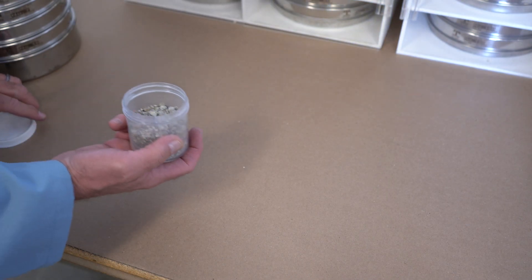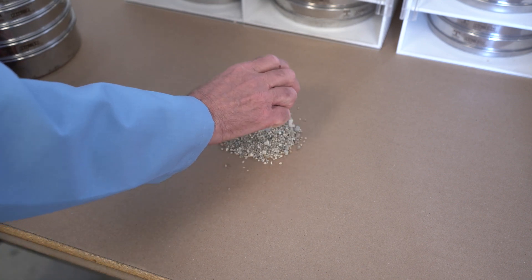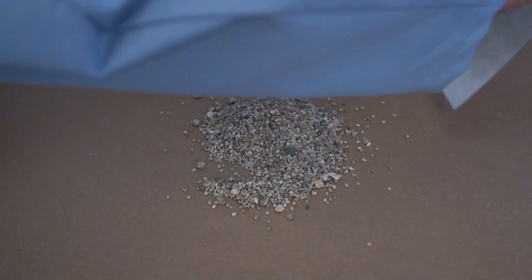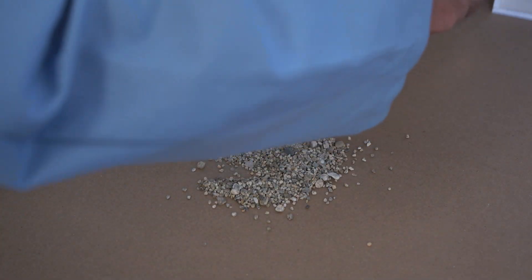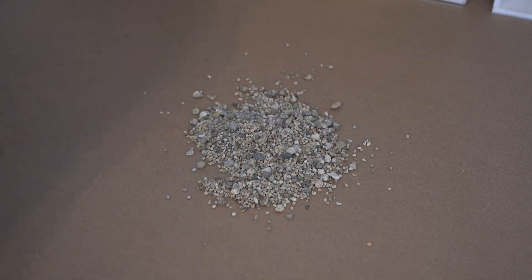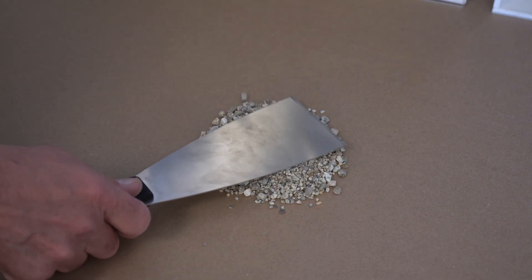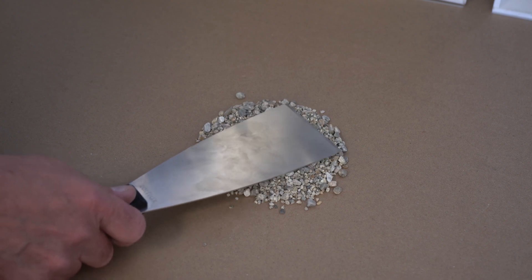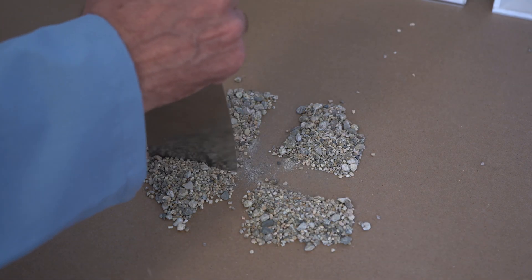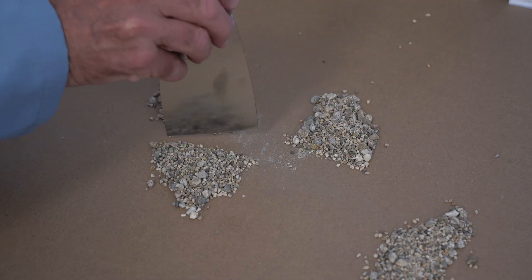Pour your material onto a clean flat surface. Once you do this it will naturally result in a cone shape. Using a large shovel or another suitable tool, turn the entire sample over at least three times and then form the entire sample into a conical pile. Flatten the material to have a circle uniform in thickness — this is typically done with the shovel. Cut the pile into four identical quarters, then remove two opposite corners.